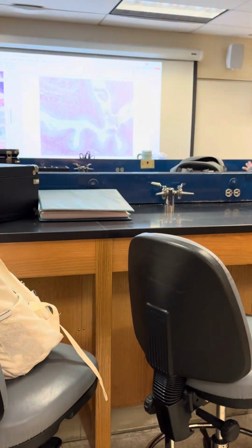Is this what the practical will look like? I believe he does his on the screen also, and just asks questions. You'll have to fill out lines, and you'll have to say simple squamous epithelial tissue. That's how I do it, and I think that's how he does it too. It is definitely a fill-in-the-blank kind of test where you have to come up with the words. The lamina propria, let's go back there real quick.